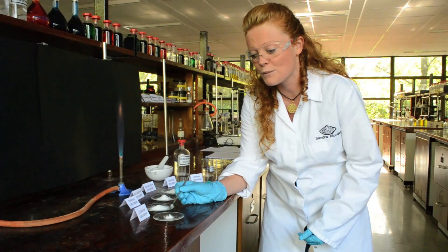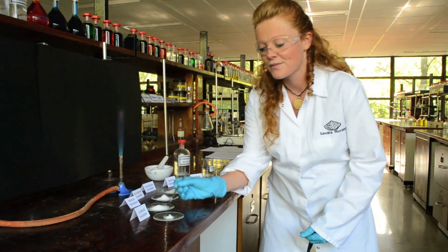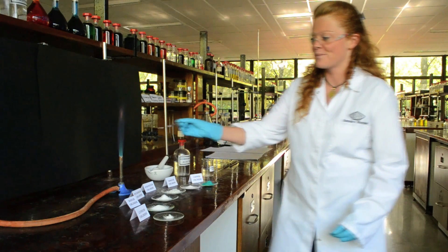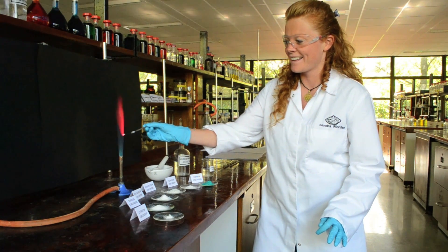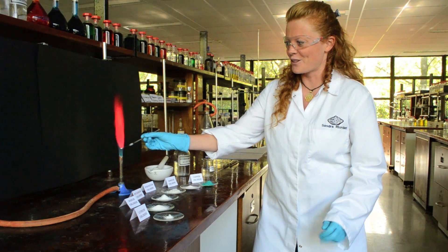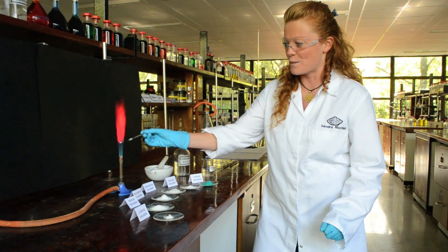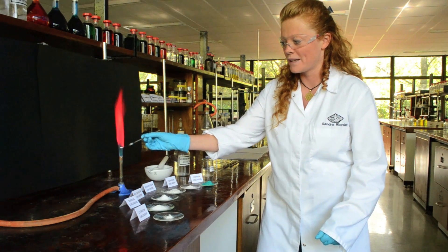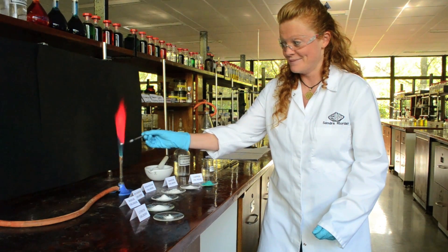I'm going to take lithium chloride as my first salt and burn it in the flame. Are you ready for the colour it's going to give off? Beautiful crimson red colour from lithium. This is the characteristic colour of lithium — when you see this you know there's lithium.